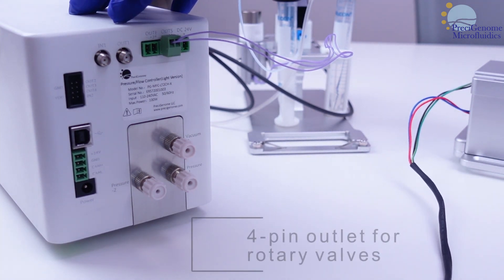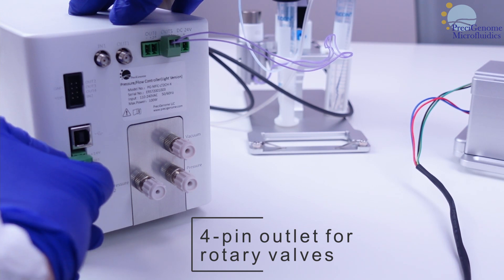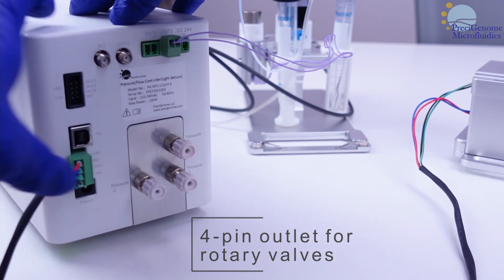Rotary valves may be plugged into the 4-pin outlet, which may be split into multiple such valves.